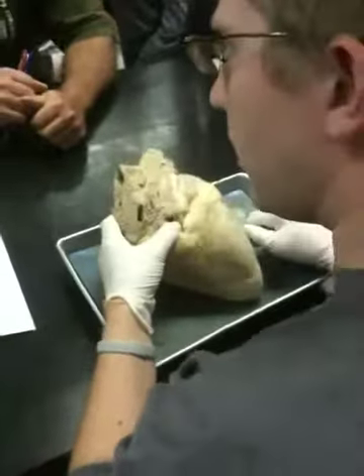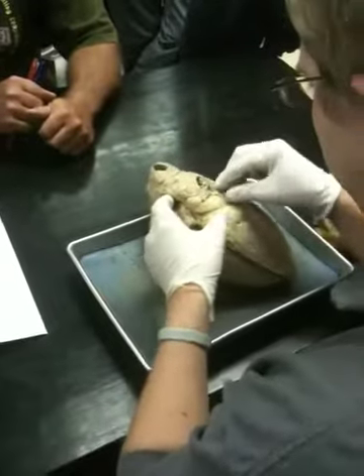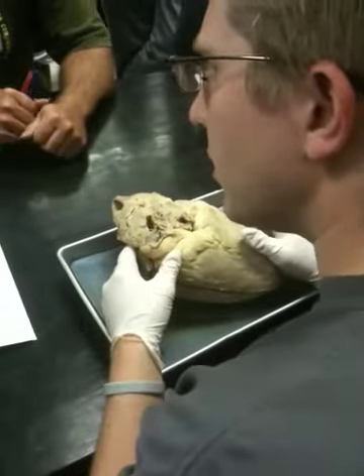Base. Pericardial sac, there is none on this one. Well, maybe some of this tissue is pericardial sac. Yeah, this is. See, it just surrounds it. Most of them don't have that.